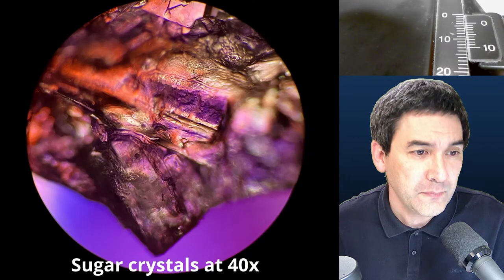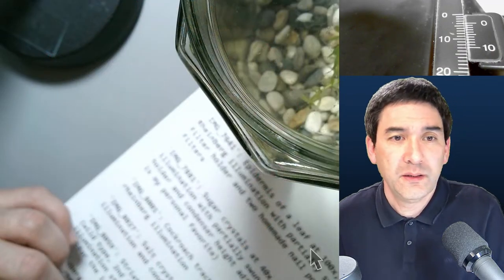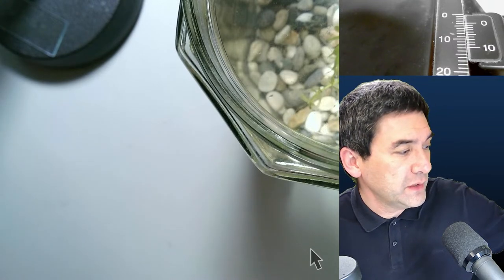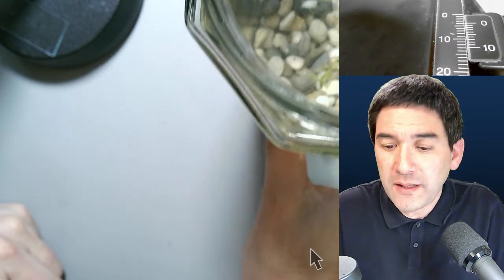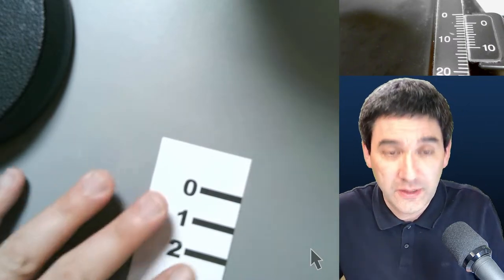Let me go back now. What I'd like to do first is talk a little bit of theory, then show you how I've made some scale bars, talk generally about magnification, and then — if the theory is a bit dry — I've also prepared some water fleas to observe later. First I'd like to explain the stage micrometer up there. Maybe some of you already know how to use it; if not, I'll explain it because it's very useful for making measurements under the microscope.